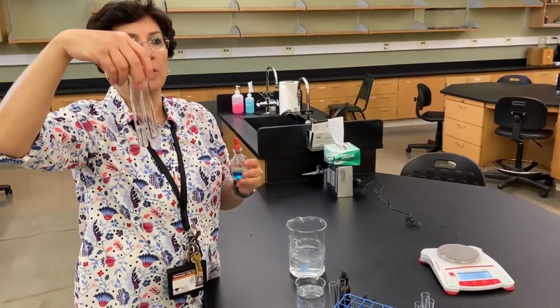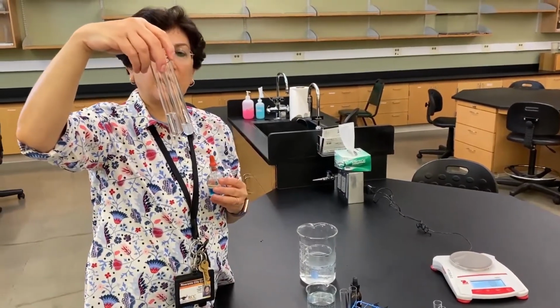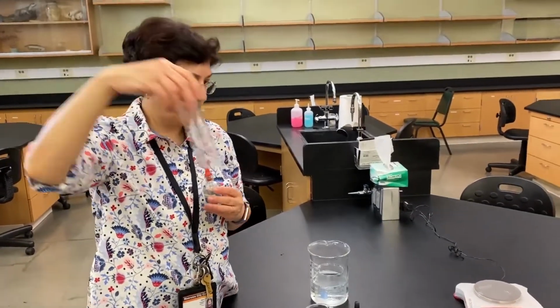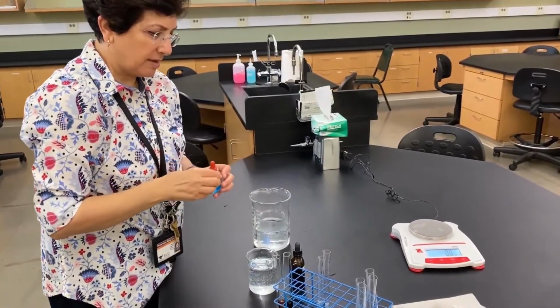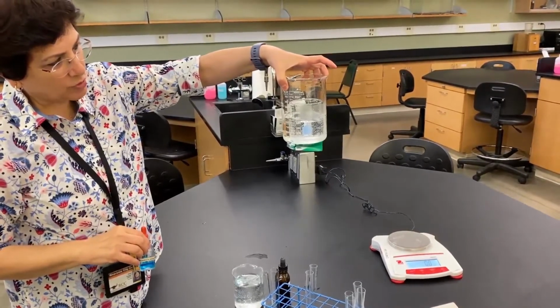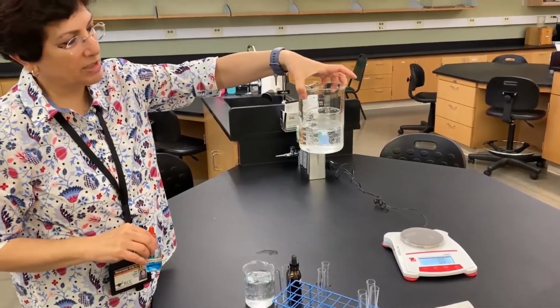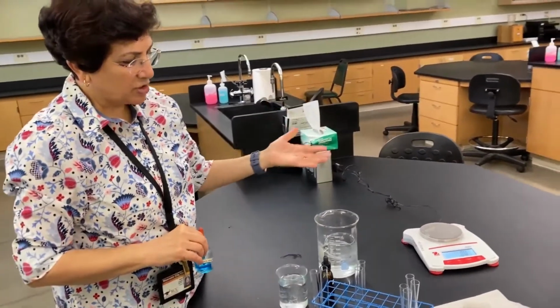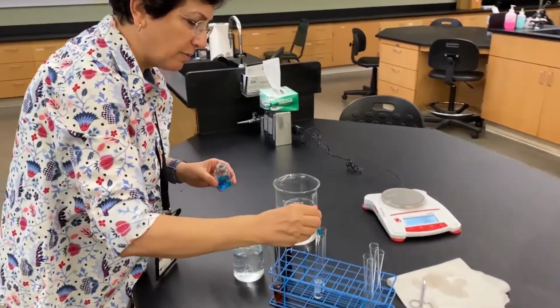Water bath meaning we can control the temperature of the water, and we usually have it about 80 degrees Celsius. And this is where we're going to see if there is a change in the color. Because it's a little demonstration, I didn't want to turn on the water bath and do all of that. I'm going to create the same environment by putting those tubes in a beaker and putting the beaker in the microwave for a minute. And we're going to see if there is a change in color. But that high temperature is required for us to see any sort of results with Benedict's.